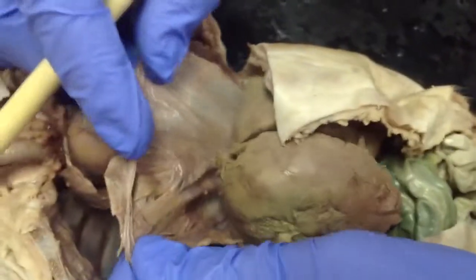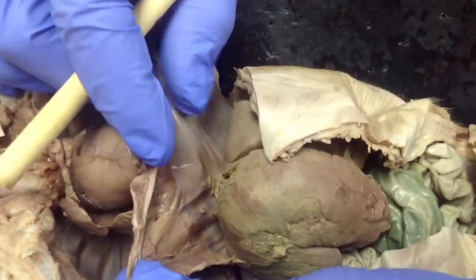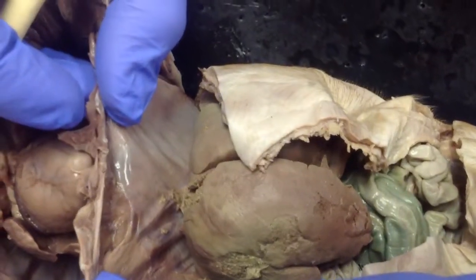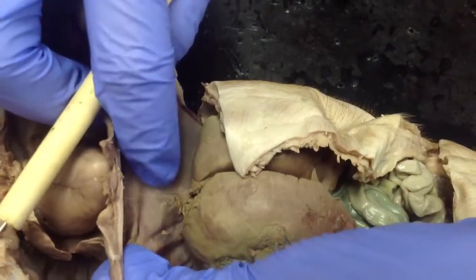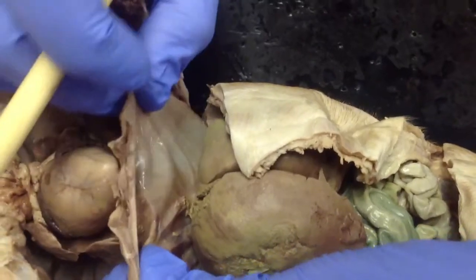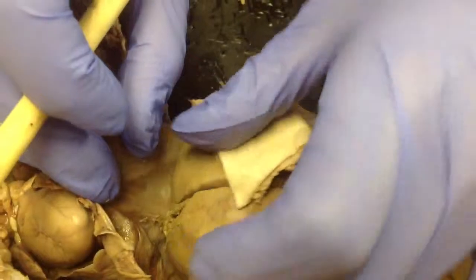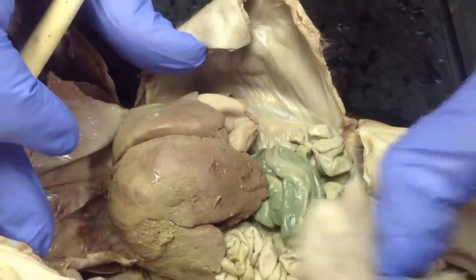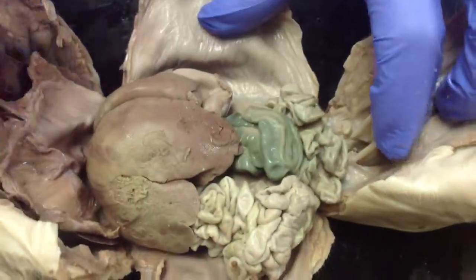All right, moving down underneath the heart, we come across this thin sheet of muscle right there, if you can see it. Remember, this thin sheet of muscle separates the thoracic cavity and the abdominal cavity, and that's your diaphragm. Now, all mammals have a diaphragm. It helps with breathing. So we're going to move down through that thin sheet of muscle, and now we're into the abdominal cavity. Let me pull a few things back so you can get a good look at all the parts in here.